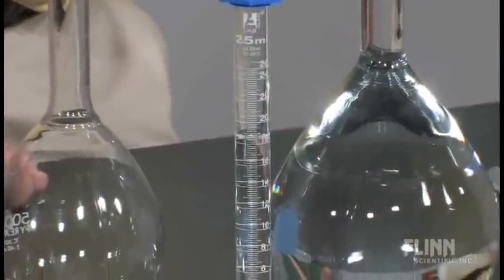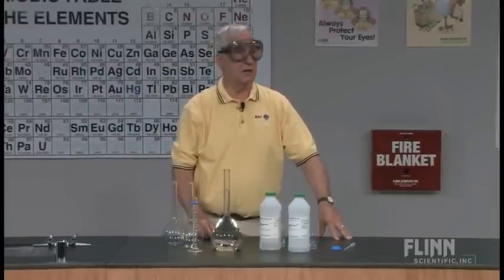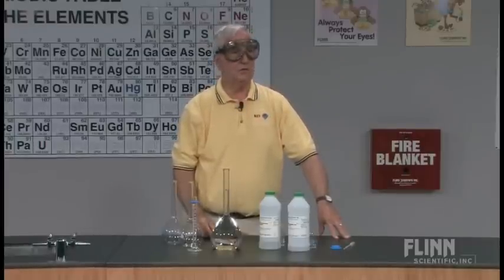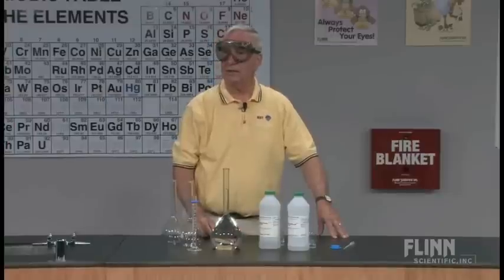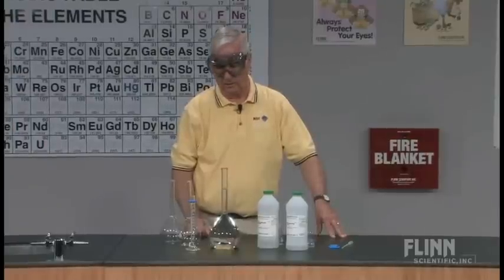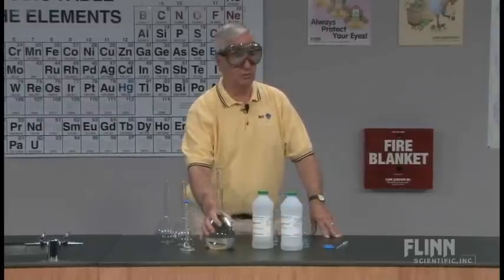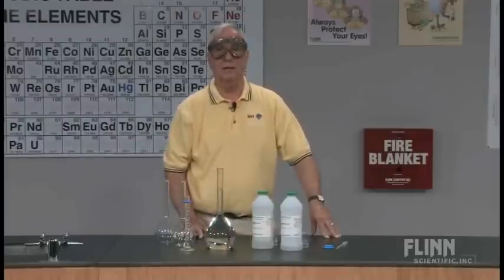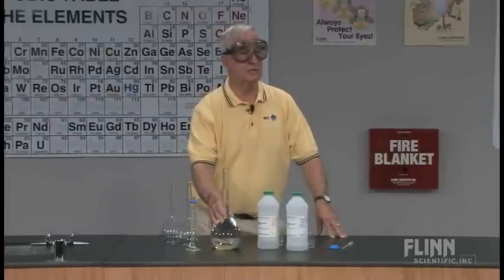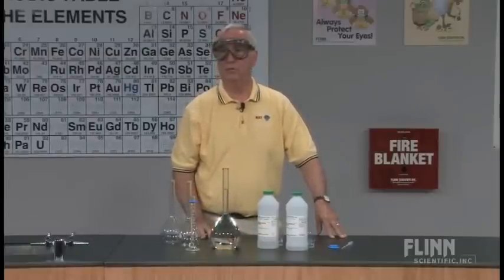Now this is a very simplistic explanation for a possibly very complex situation — it's not quite as simple as this, and there are other things happening in the flask. But for a general chemistry class, we have a very simple demonstration that illustrates at least a good example of production of one mole of water. Of course, some things to consider: the flask is a little bit warm, so we have some thermal expansion, and the different molecules are reorienting themselves, possibly contributing to some of the increase. But there is no doubt that most of that volume change is caused by the production of one mole of water.